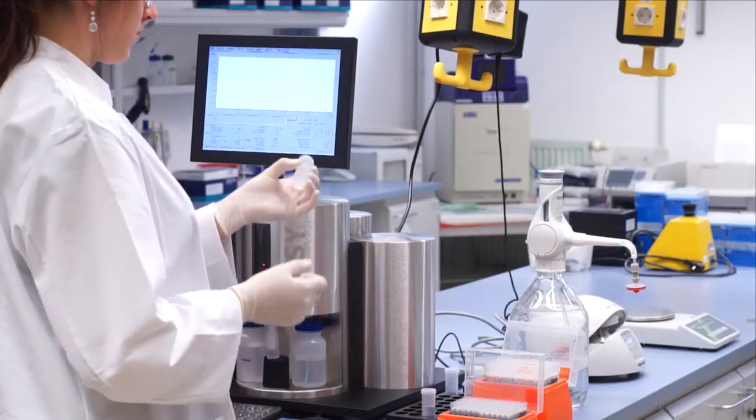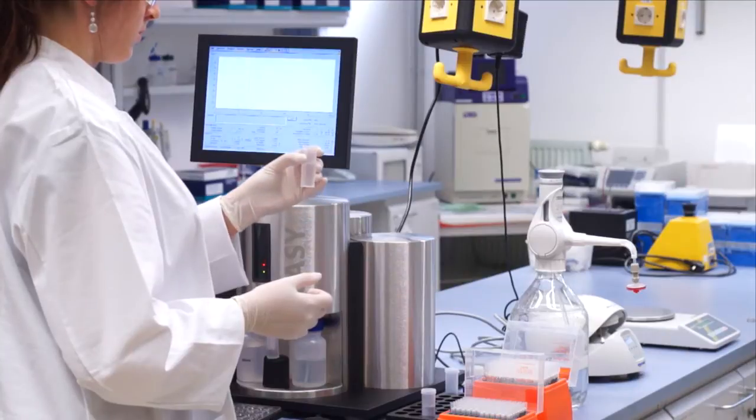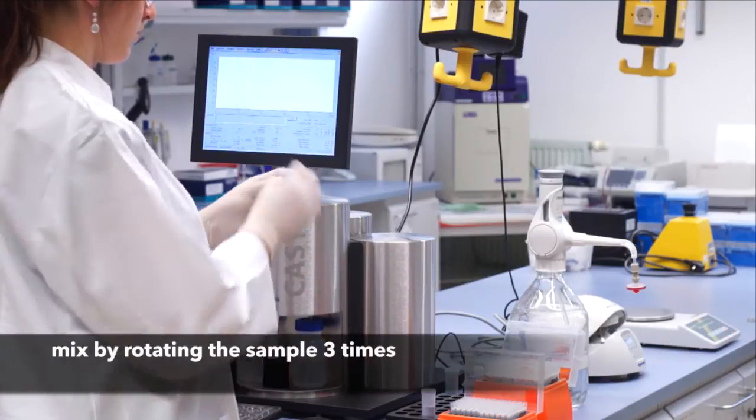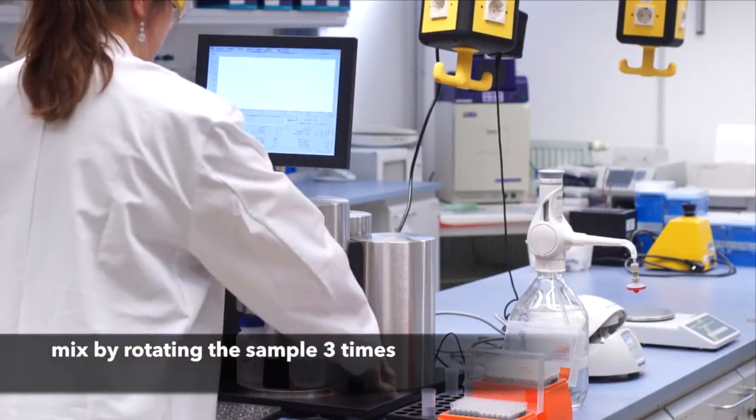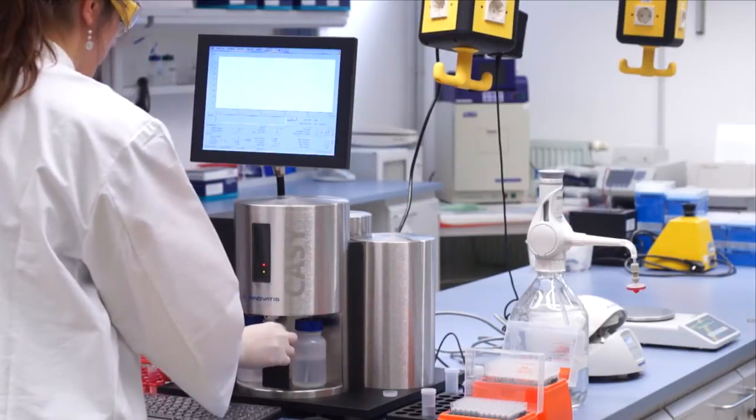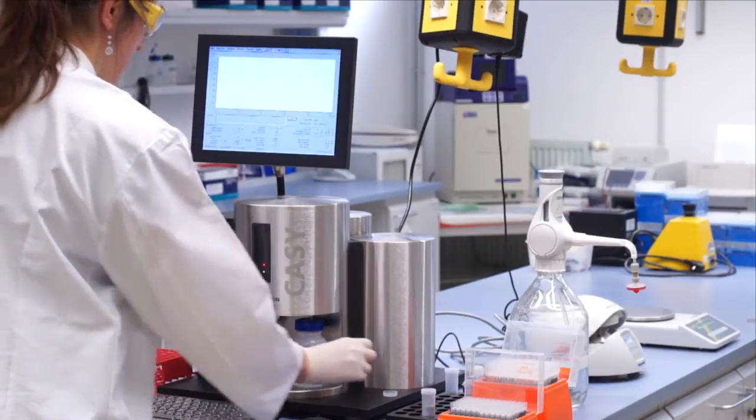It is mixed simply by rotating the sample three times. This is sufficient to ensure thorough mixing. The sample is then placed on the sample base and the measurement is started.